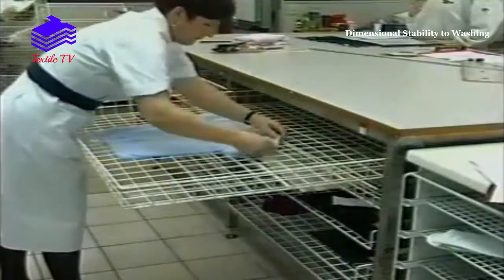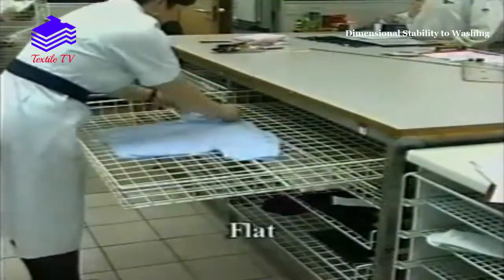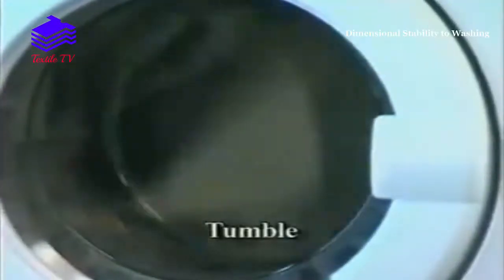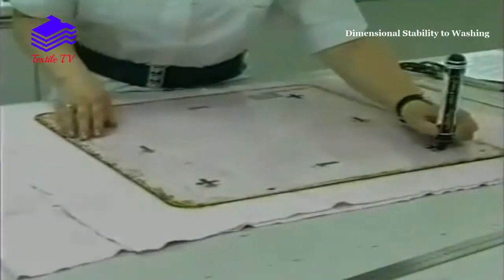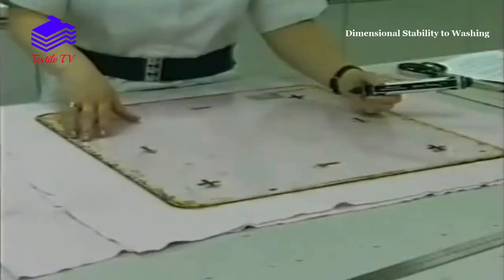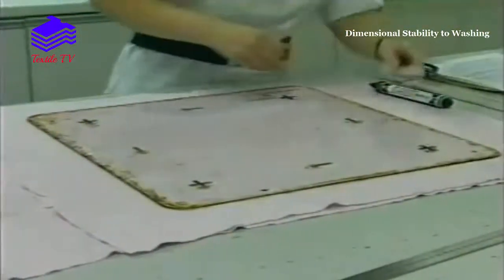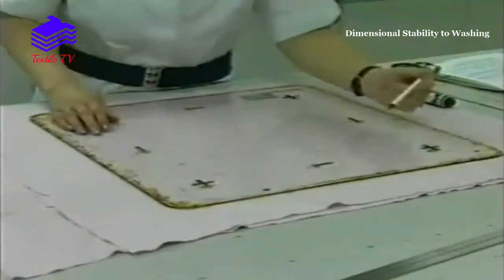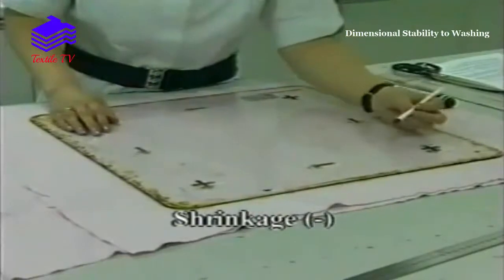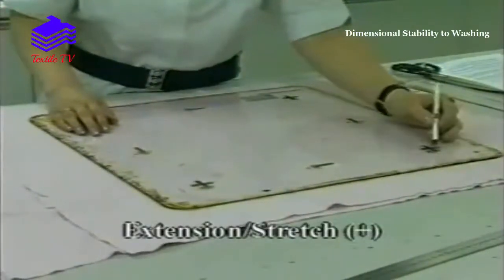The specimens are then dried either flat, line or tumble. After relaxing, the specimens are re-measured and the change in dimension calculated as shrinkage (minus) or extension and stretch (plus).